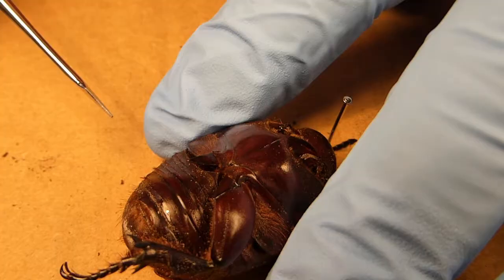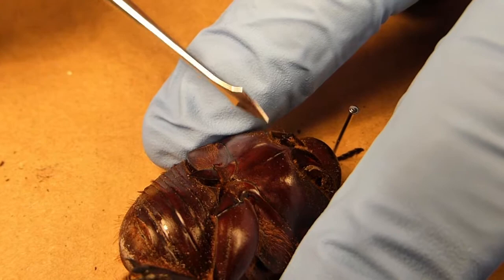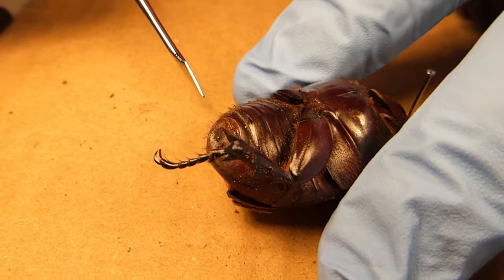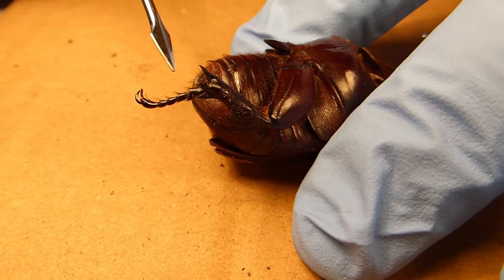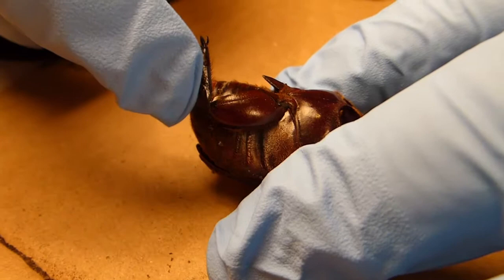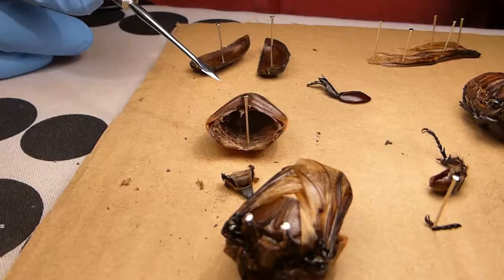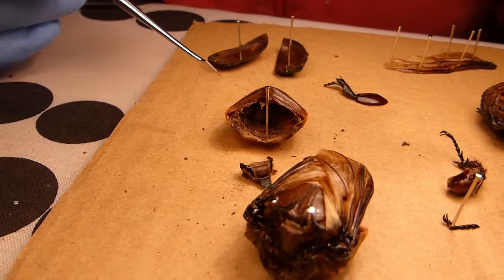You can see these nodules here — this is where they connect to the main body of the beetle. So this is now the ventral side of one of these beetles. You can see here this is the space where the forelimbs were attached. This is the segmentation down the body, and this is the pygidium. Where this hind leg is attached, you can see this is much flatter — the beetle is squatter down to the ground at the back. And you can see the spikes and the tarsus with the claws. Because this leg is still actually attached, I can show you the movement in this joint. As you can see, this is the back section of the insect. This is where it has desiccated, left in a very dry environment for a couple of months now.